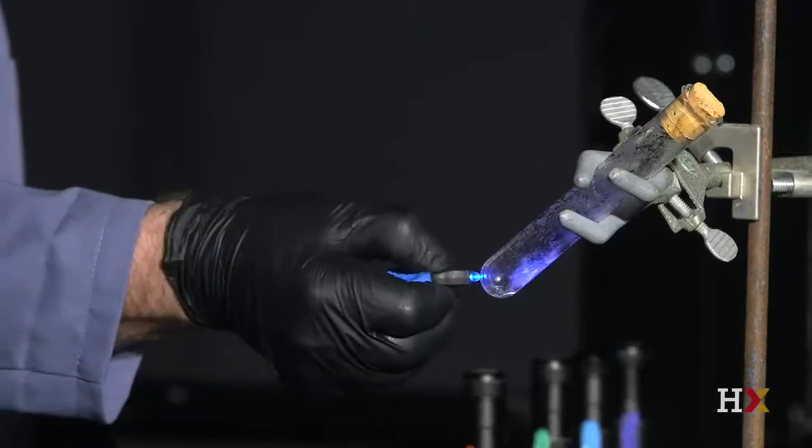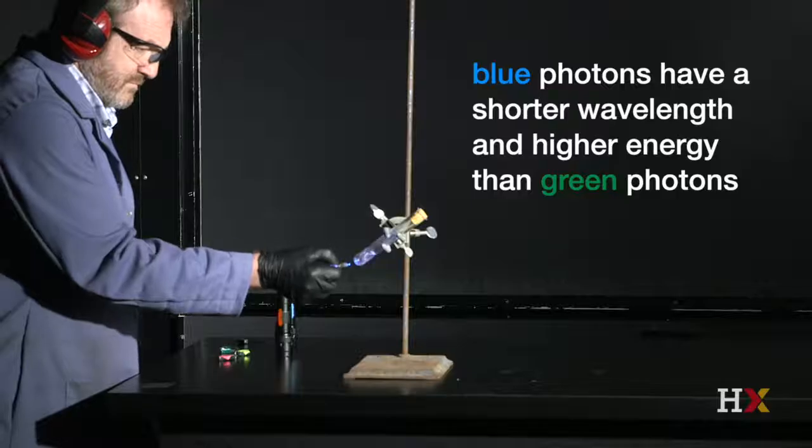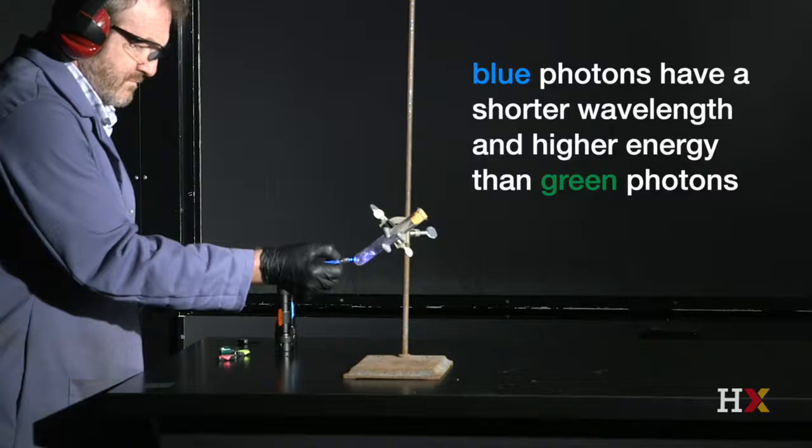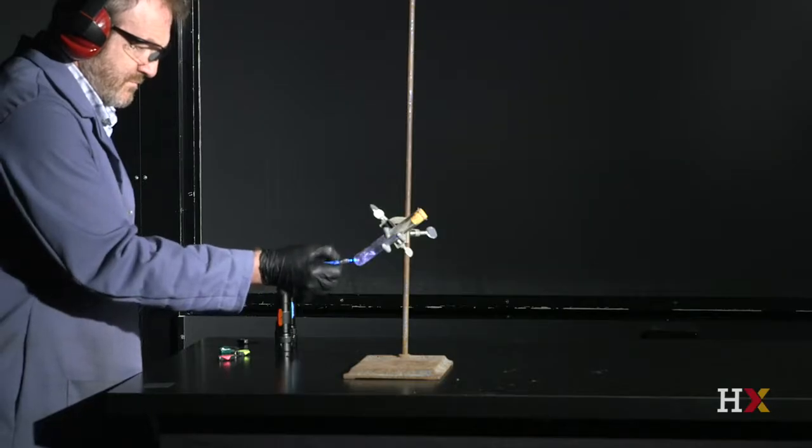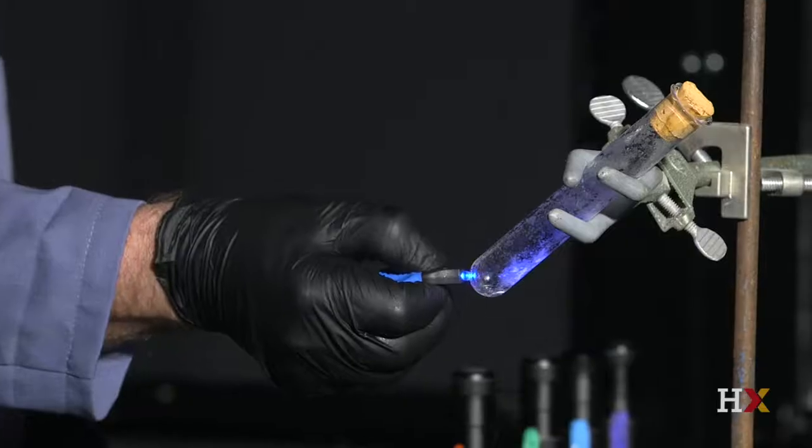Next, we test blue photons, which have a shorter wavelength and higher energy than green photons, by shining a blue LED flashlight on the test tube. There is still no reaction.